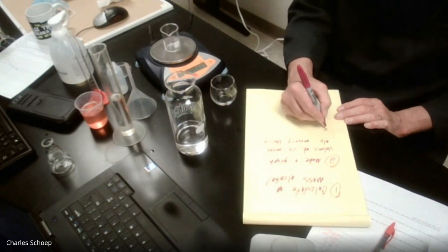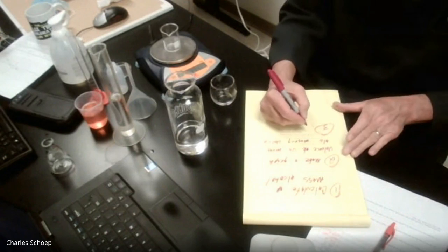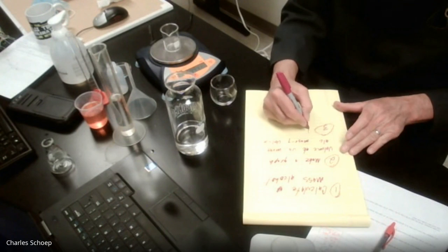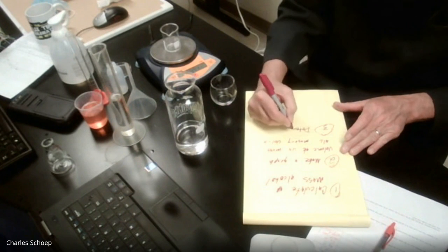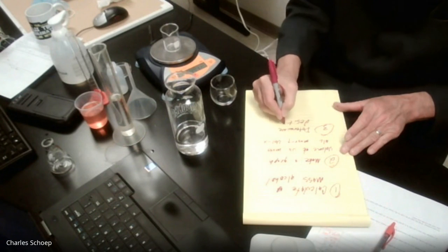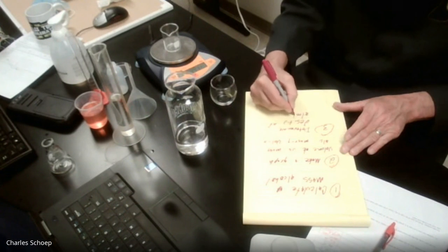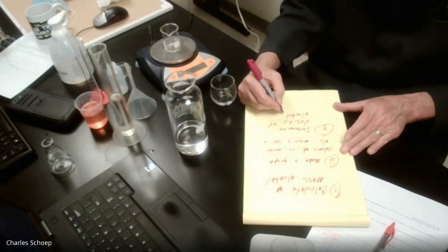And then the third thing I want you to do, sorry about that, is determine the density of the alcohol mix.